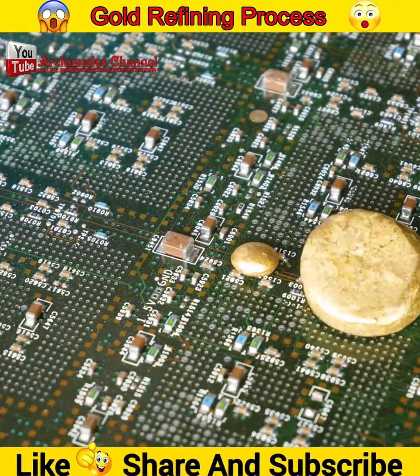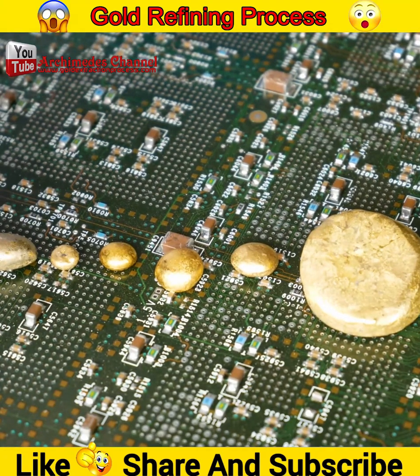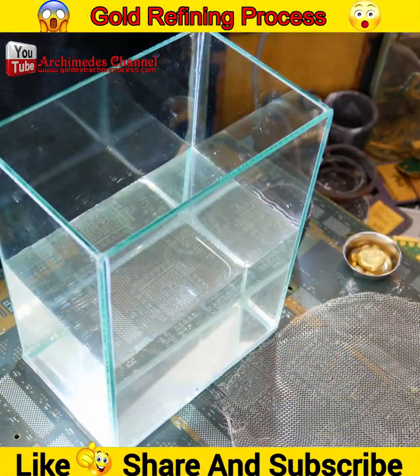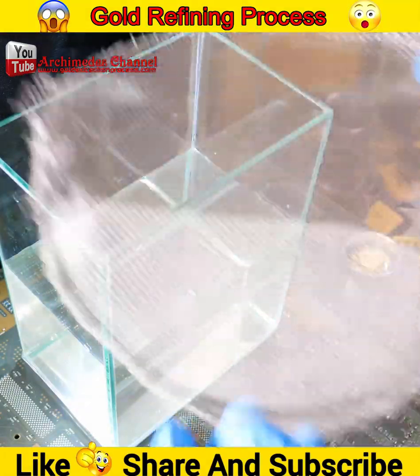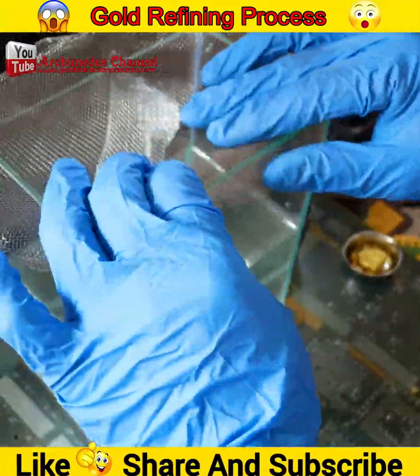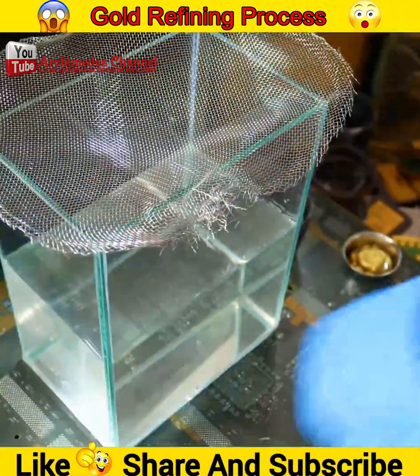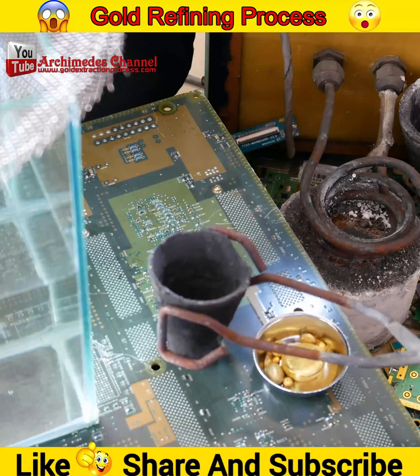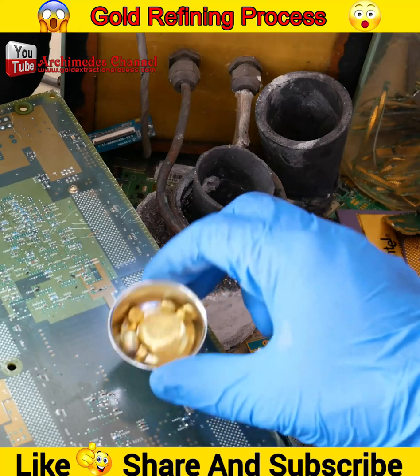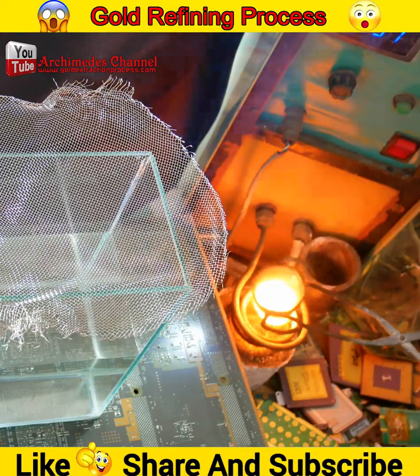Hello friends, today I have a way to make pure gold bars 24k from gold scrap. Sometimes you may want to make some extra money by refining your own gold at home, or you may be a jeweler who wants to refine gold in-house. Start by reducing the size of gold to smaller pieces — melt gold and pour it through a two-millimeter sieve into water. Reducing the size will help the aqua regia process dissolve gold into solution more quickly.